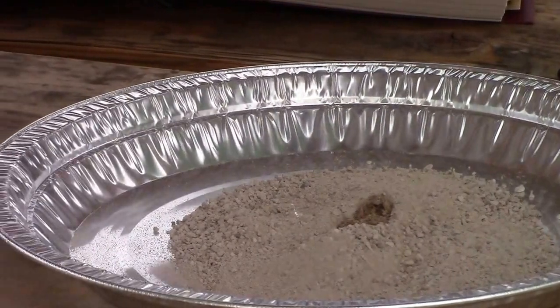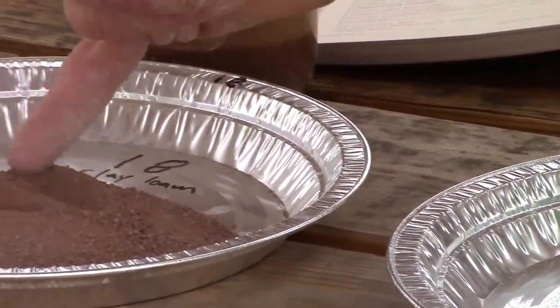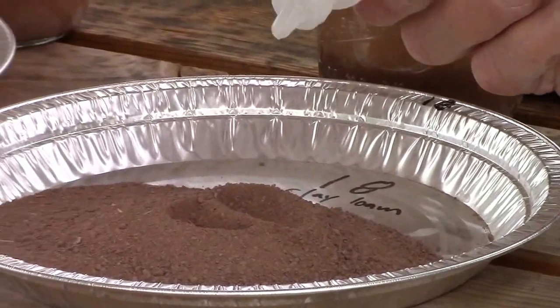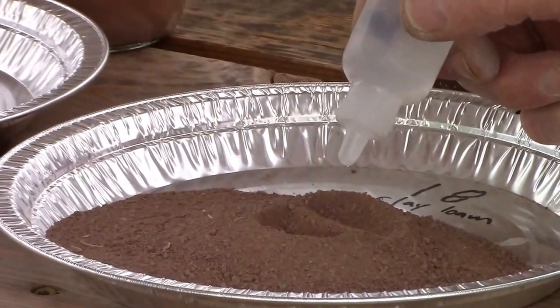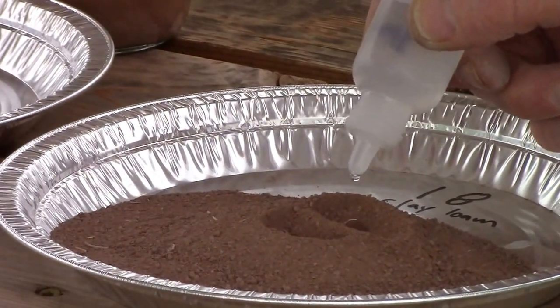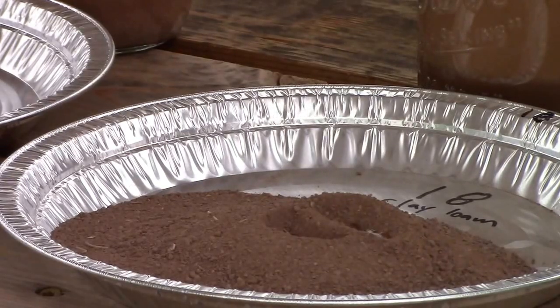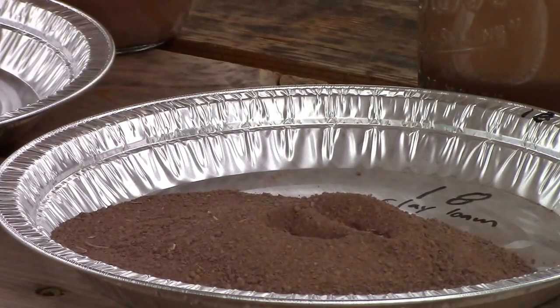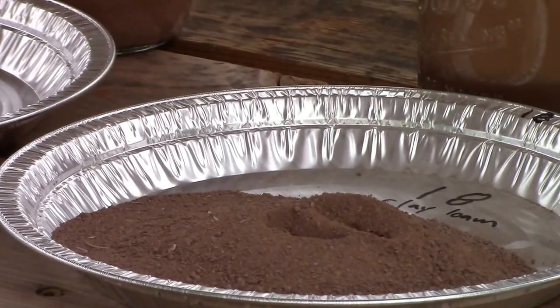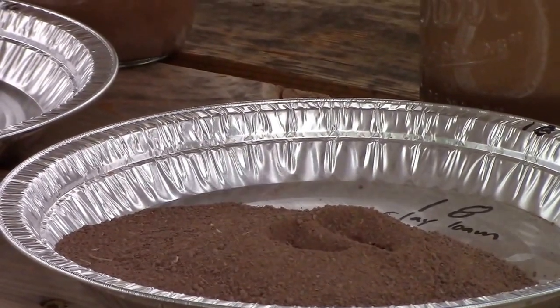If we go down the line here, this clay loam soil from New Mexico — also pretty violent. I would say that's also VE, violent.